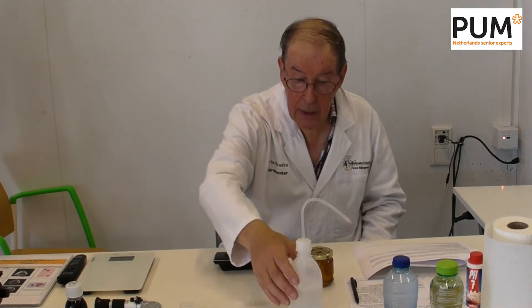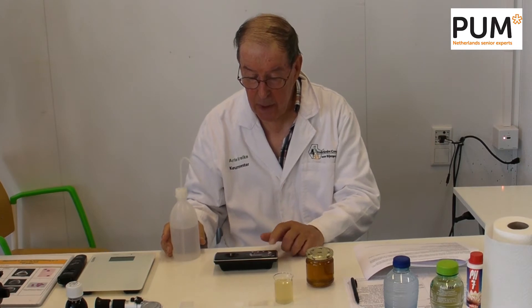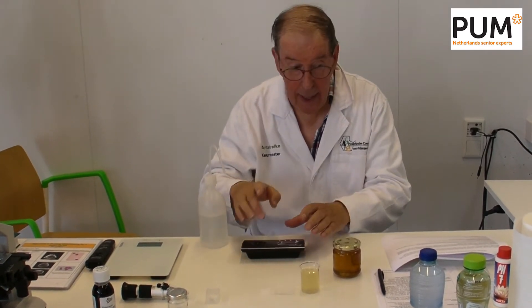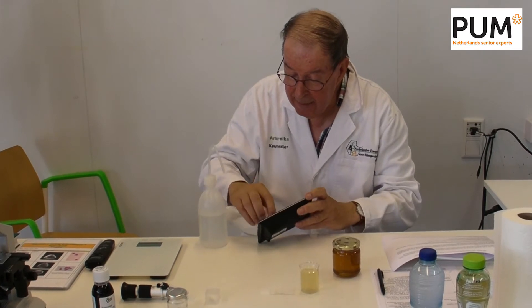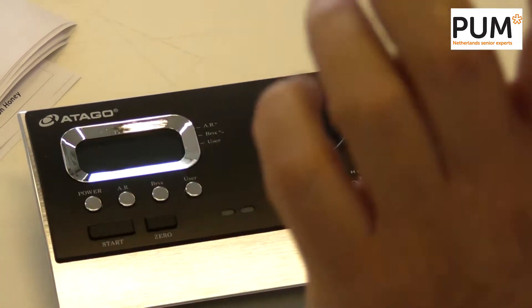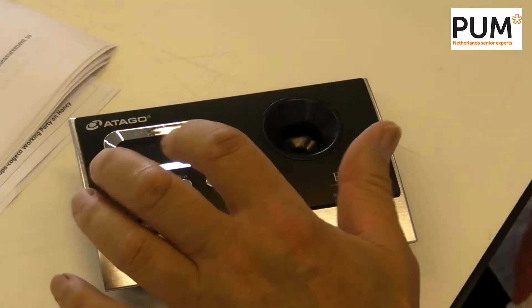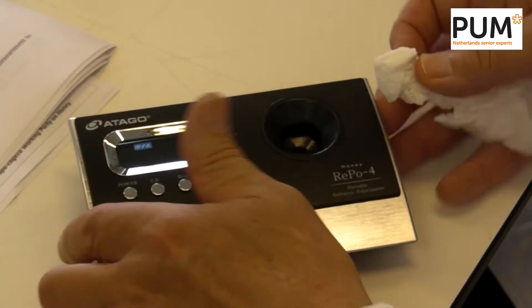What we are doing is taking deionized water, and I press the power on to put the system on working. Now I wipe the measurement screen inside very clean. All dust and all other particles should be removed. For operation, to set the calibration point — the zero setting — we are starting with the calibration. Put the power on. You will see if the battery is okay and all kinds of other things. We have cleaned the measurement area in there.